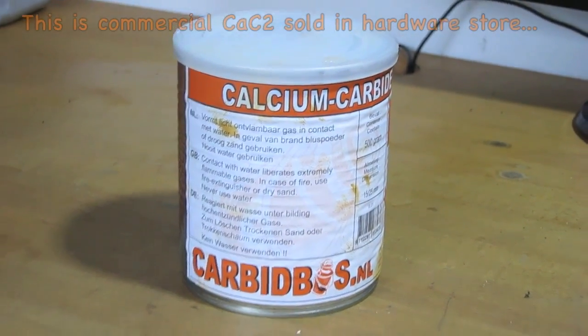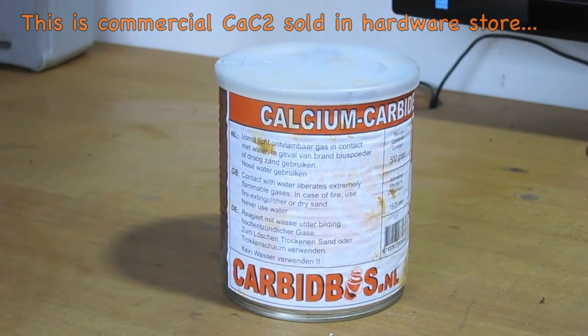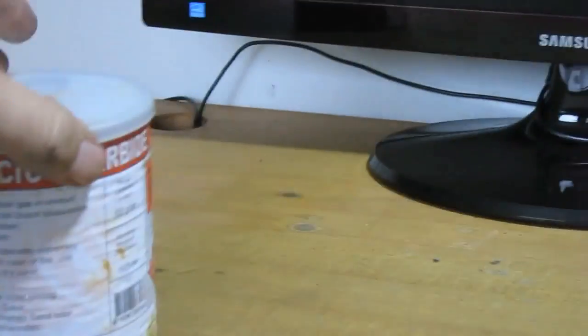Calcium carbide, CaC2. Well, I'm going to tell you something about calcium carbide, CaC2, and how I'm going to make it myself.